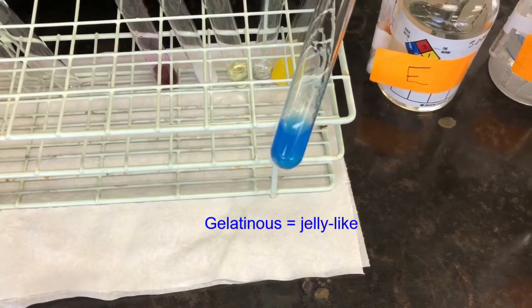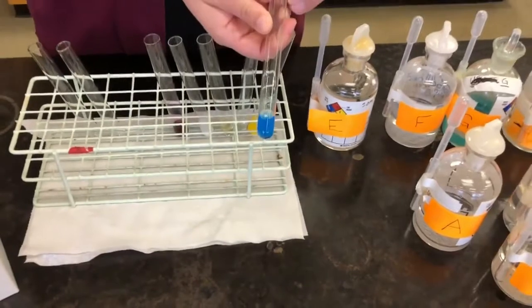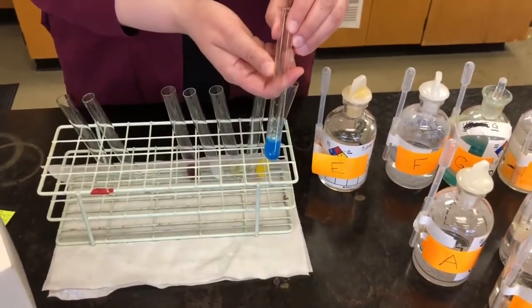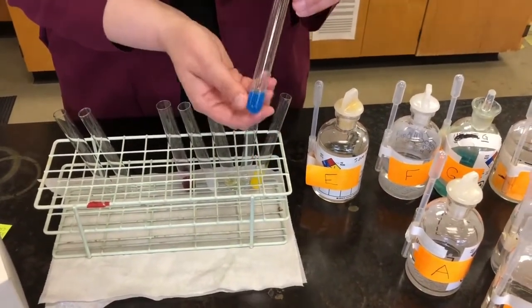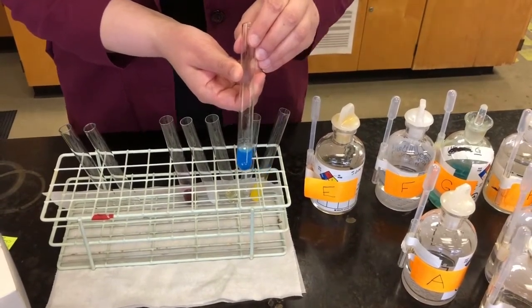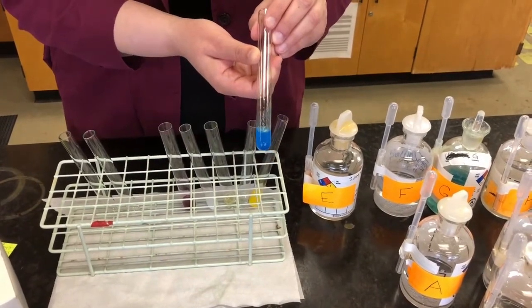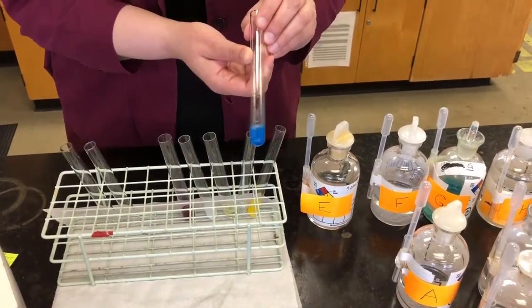Okay? So our observation, it turned blue, produced a blue product. Okay? There's no odor, there's no heat being given off or anything else. Our deductions are going to be that E and G reacted to produce a blue gelatinous solid.